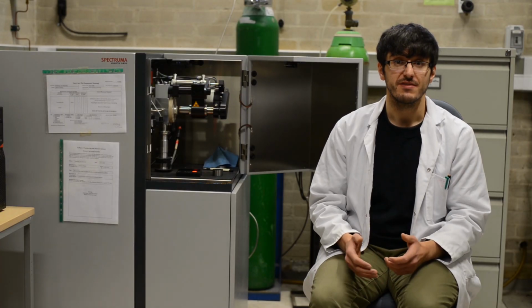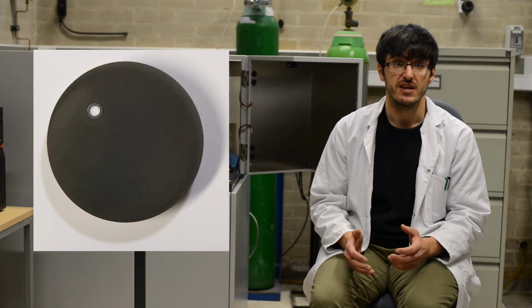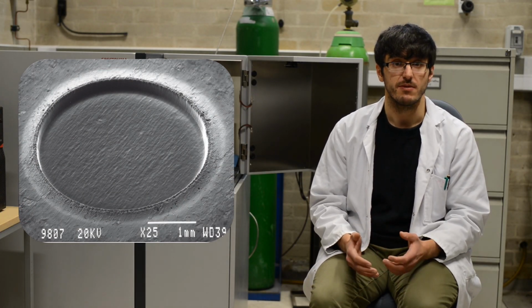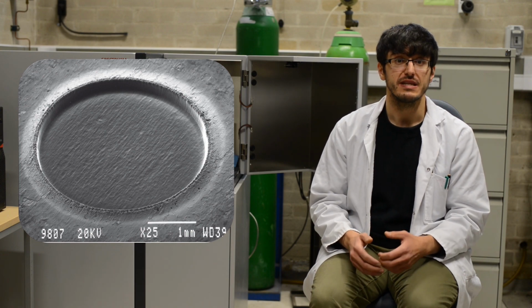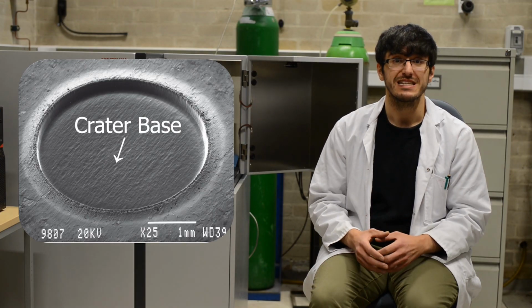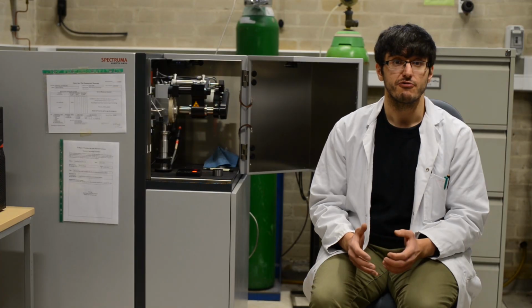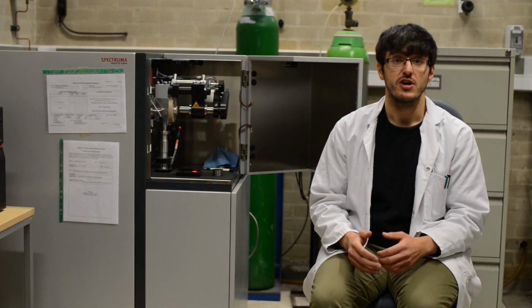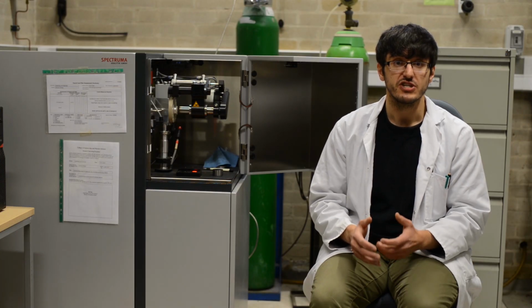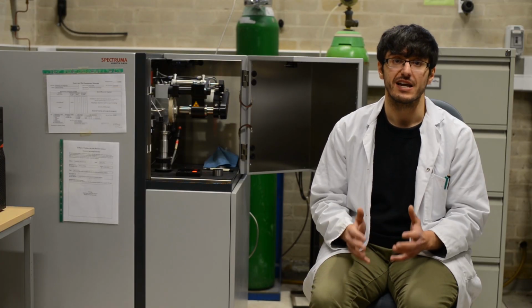However, as with any machine, there are several drawbacks. These include 1, the fact that it is a destructive technique, and so, as you can see here, it creates an etched away crater on the surface of the sample. 2, due to the need for a flat crater base to give an accurate depth reading, depth profiling is limited beyond 100 microns because of rounding of the base. And 3, due to contaminations such as oxides or grease on the surface of samples, and the delay for stabilization of the plasma, the first 100 nanometers of the GDS depth profile can be inaccurate.